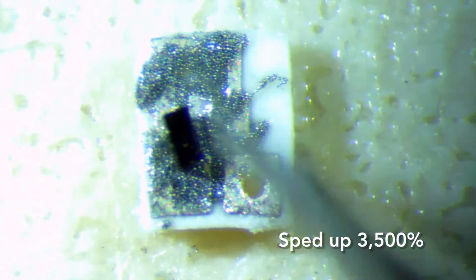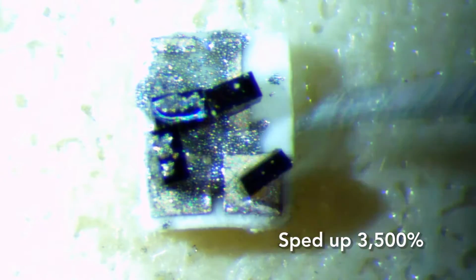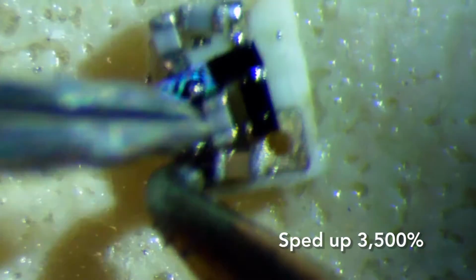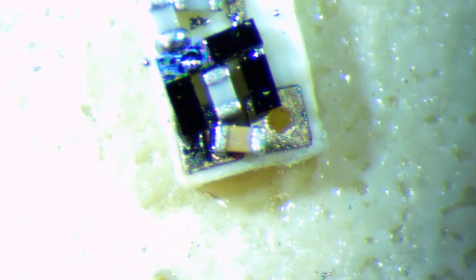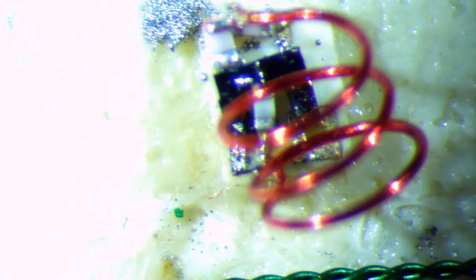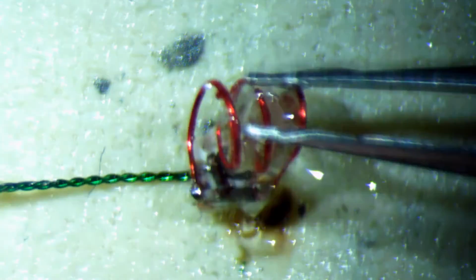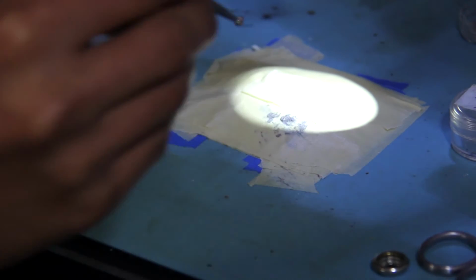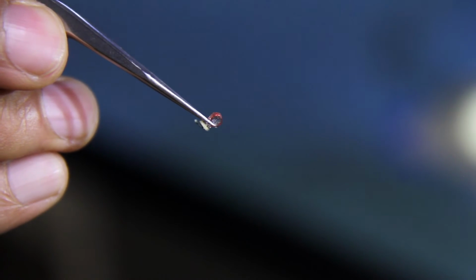First, you paste the solder paste on top of the board, and then next, put the diodes. Make sure that the diode's direction is correct. And after that, you put the capacitors on top of it, and also the coil, and attach them together by solder. And after that, you put the twisted cable and LED combined together, and then epoxy it. It takes about 1 day to cure. So this is already dried. Wireless optogenetics implants.